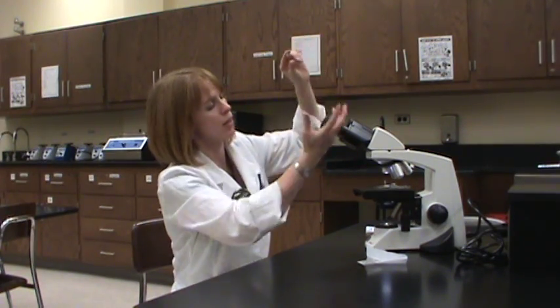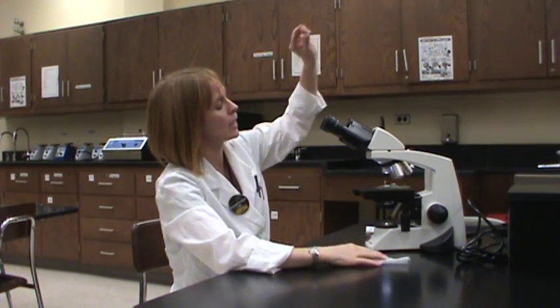Now you're ready to essentially start viewing your organism. I'm going to look at a slide that I made earlier. The first thing I do when observing microorganisms is I take my smear and hold it up to the light. The reason why I do this is to try to see if I can see anything with my naked eye — sometimes you can see a little shadowy things or a little film, and this will give you an idea of what to aim for. I can see something on my slide pretty easily, so I know for sure that something is on there.